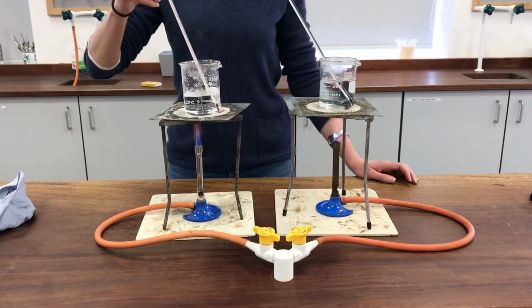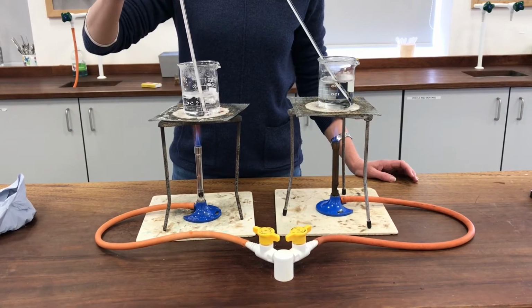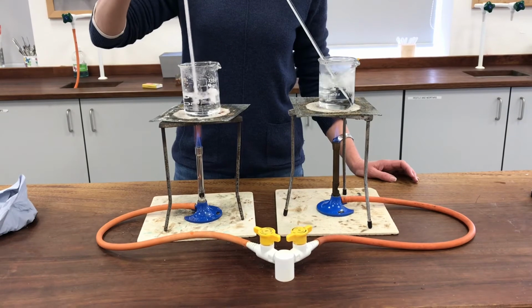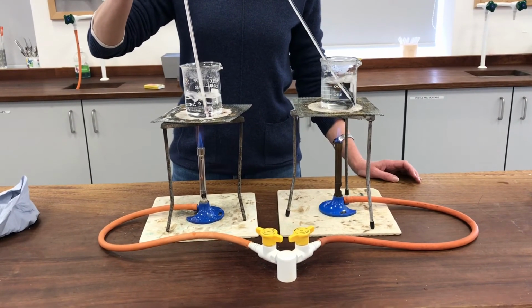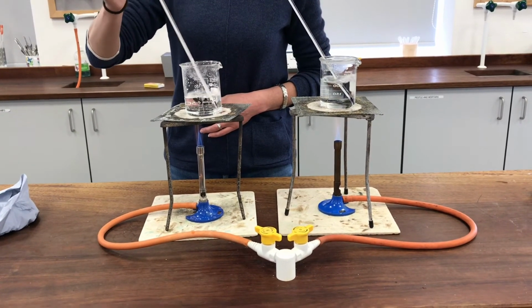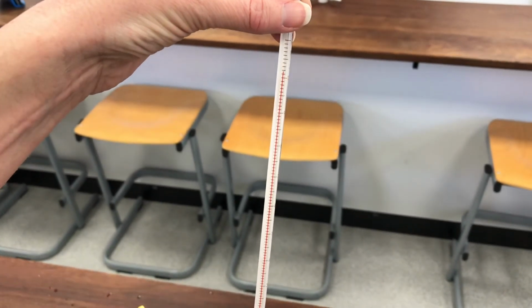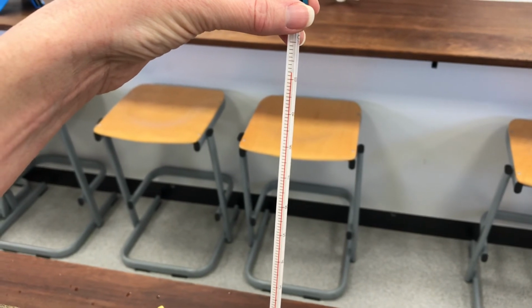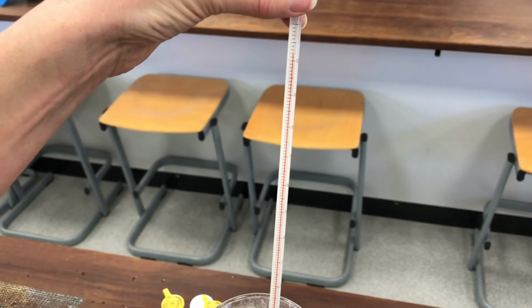This one, the salt water, let's take the temperature. This one's actually a touch higher than 100, it's actually on 101. Well, I think that's evidence, that's proof that it really is not pure water in this beaker, which of course we knew because I put salt into it in the first place. And this is the impure water. You can see that the temperature, gosh, it's even gone up slightly higher than 101, it's on 102 now. So you can see the boiling point of water is really affected by whether it's pure or impure.